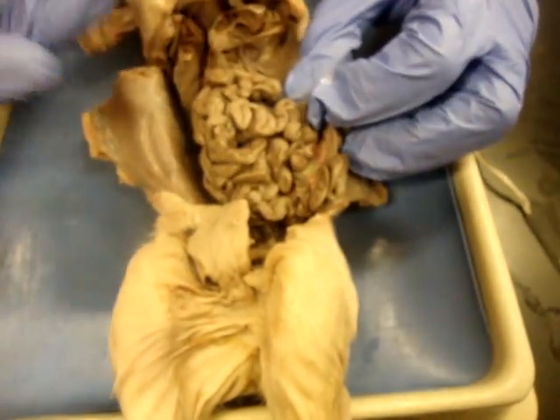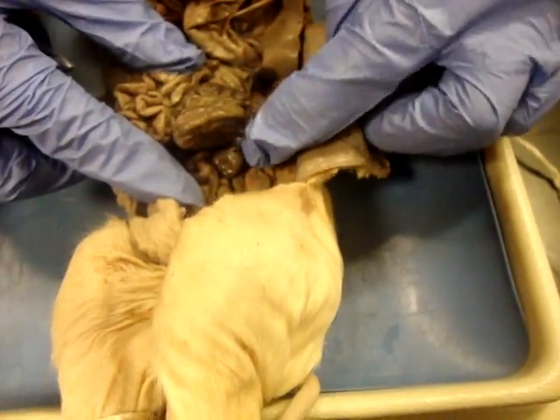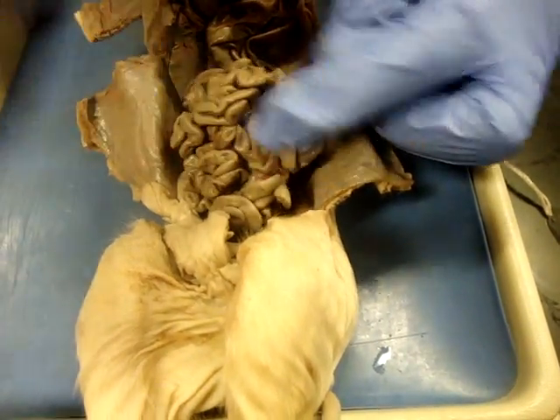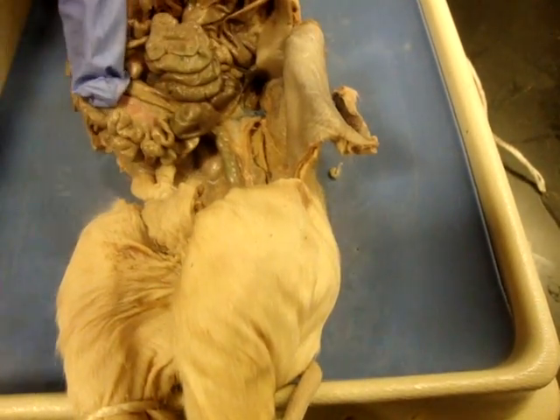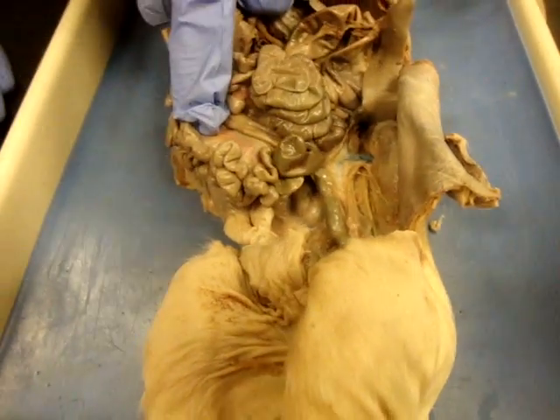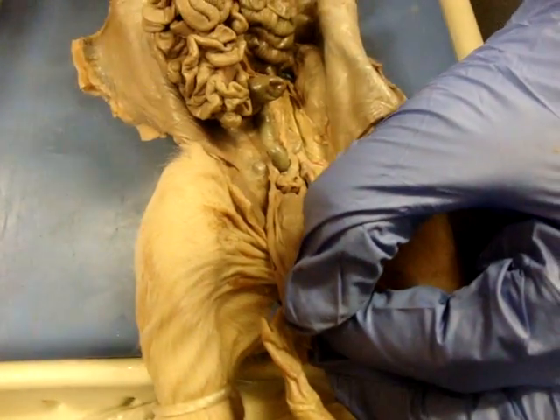From there, we'll go to our small intestine which fills up a good majority of the abdominal cavity. All of this is small intestine, and then all of this condensed over here is going to be our large intestine. This is different than what you find in humans — in humans you've got your small intestine framed in by your large intestine with your ascending, transverse, descending, and sigmoid sections. Something to be able to find on our large intestine is the cecum, which is always the dead end area. Your small intestine attaches up in here and you have this little dead end portion — that's your cecum. The colon is another name for your large intestine. The rectum leads and allows waste to exit through the anus.